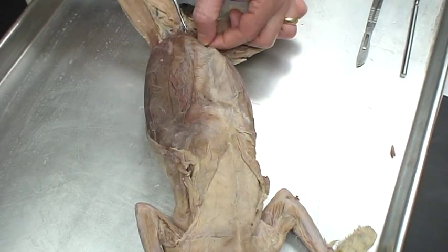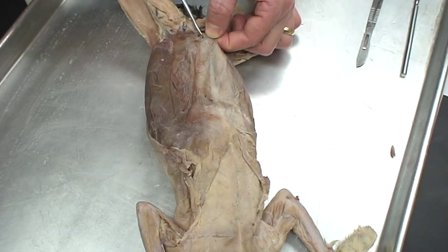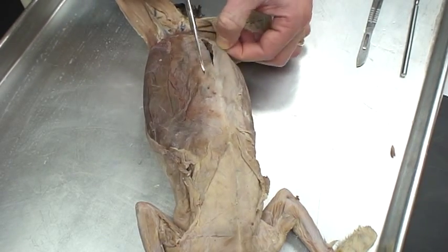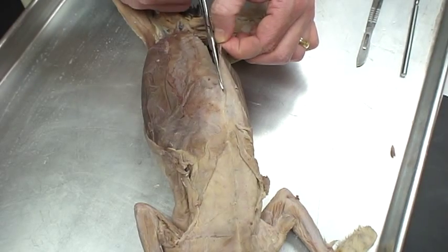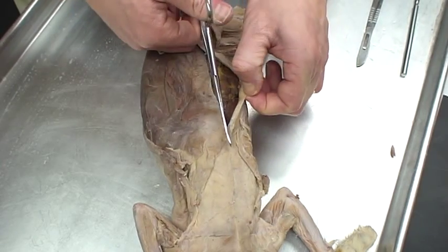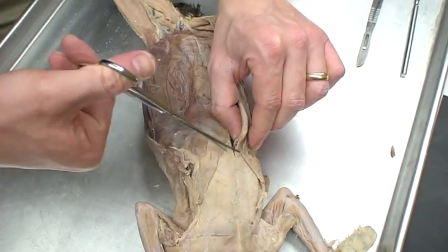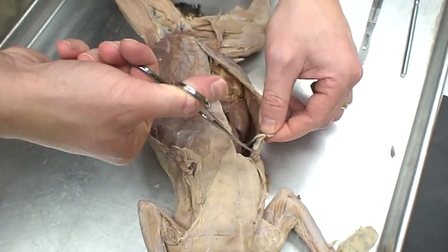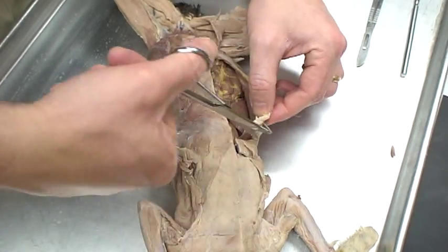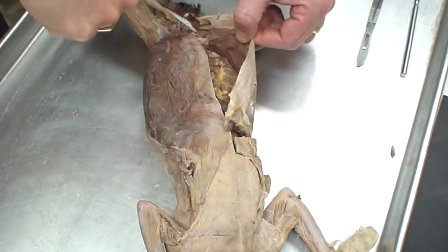I just make a small incision right along that linea alba. I'll be very careful as I go up — I'm actually lifting up on the body cavity so I don't cut any intestines. I follow that line and I'm going to cut through some ribs as well, so you'll hear my scissors clicking a little bit harder. We'll be cutting through the diaphragm just a little bit. I don't want to get up into the thoracic cavity, and I'll be going on this side as well.